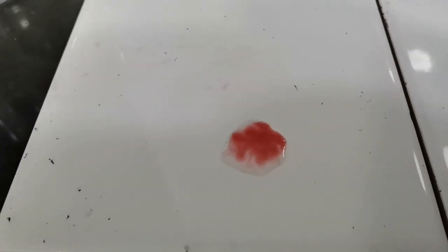Now I'll do the test again with the other solutions. Here I'm pouring some HCl onto my white tile. Now I'm adding universal indicator to it, and I get this red color. Next I am going to be adding some acetic acid or ethanoic acid onto the white tile, followed by the universal indicator, and this turns red, and we can see the difference in the red colorations in both the acids.